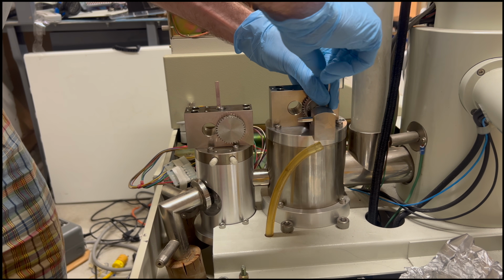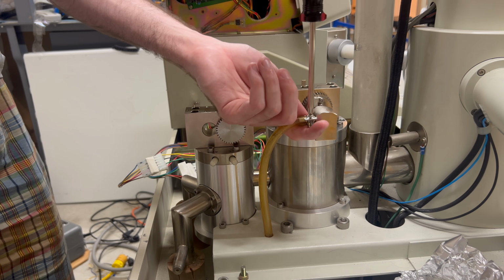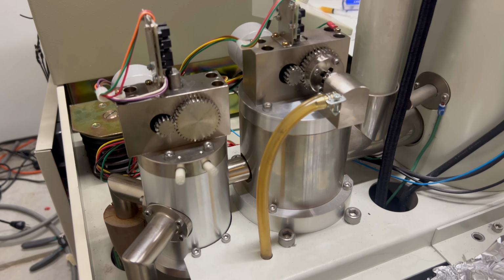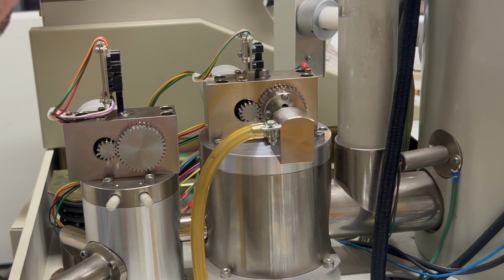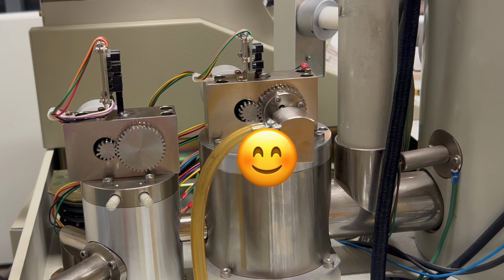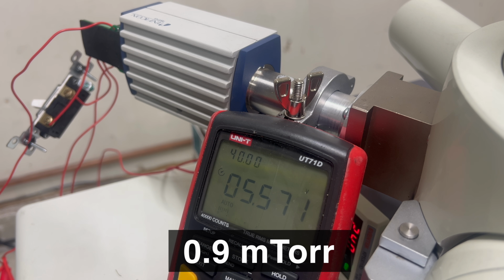After a marathon lubrication session, I managed to reassemble all the valves and get everything reinstalled on the SEM. Boy, was that a lot of effort. Let's see if it paid off. And success! The valve is no longer stuck. Now we can see if the diffusion pump is working. Well, look at that. The pressure is plummeting.